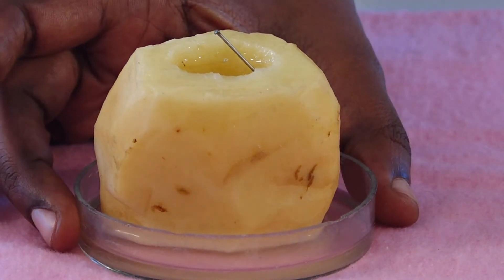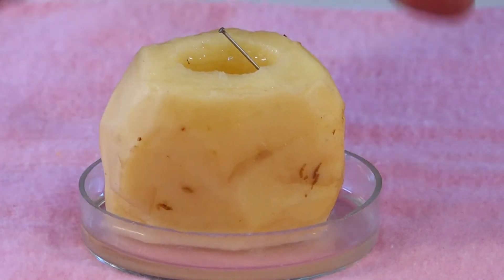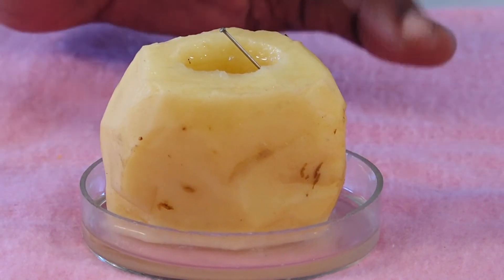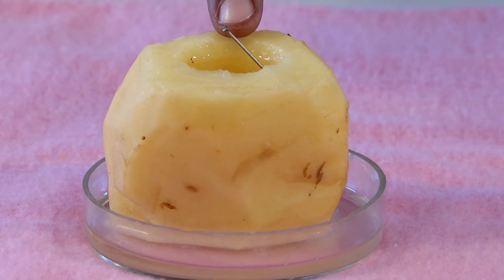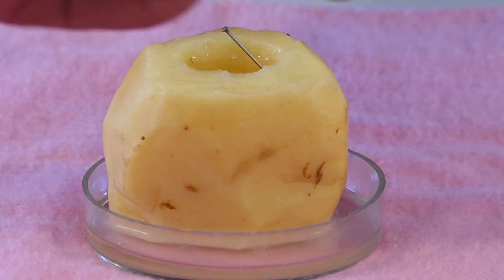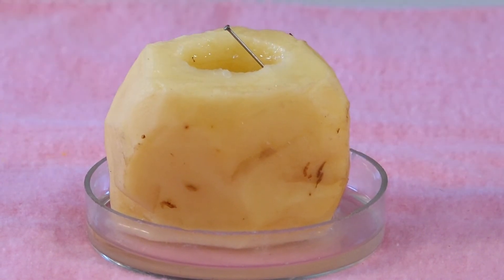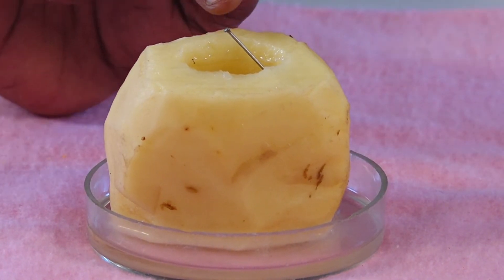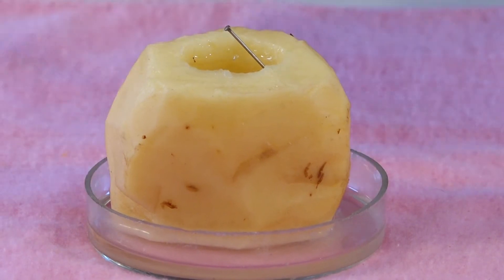This setup has to be kept in a petri plate having water. With the help of a pin, we mark the initial reading of the sugar solution level in the cavity. This setup has to be left for about 30 minutes.